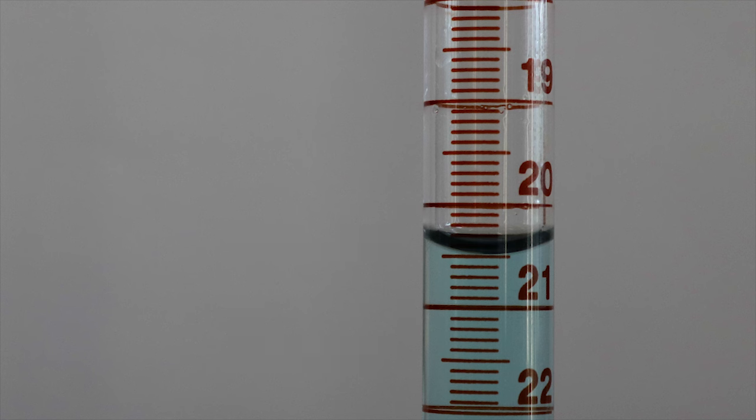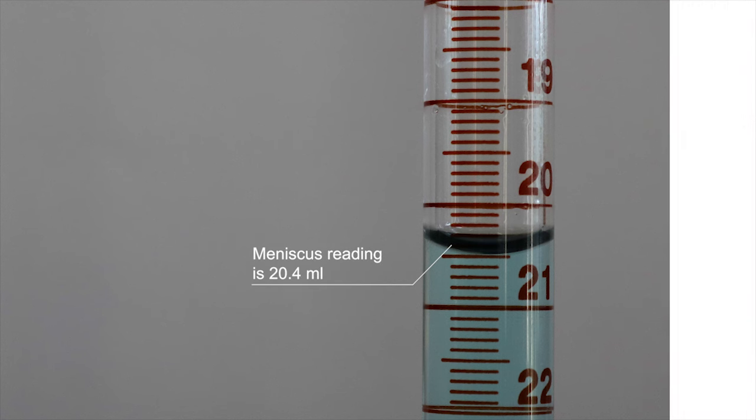We now record the first decimal place by using the same method we used before, but by using the smaller lines in relation to the bottom of the meniscus. However, if the bottom of the meniscus is on a line, the first decimal place will be the value of that line. In this example, the bottom of the meniscus lies between the 0.4 and 0.5 milliliter lines, and we would record the value as 20.4 milliliters.